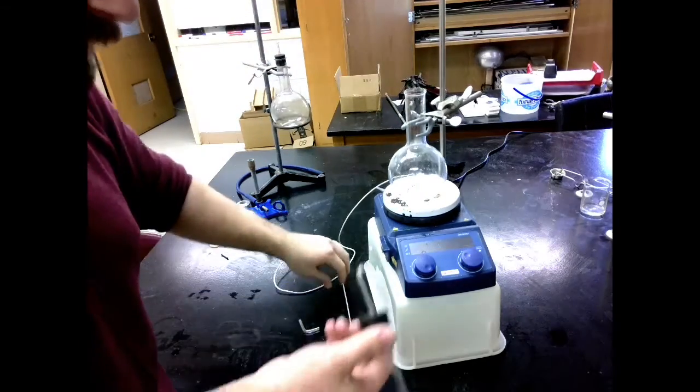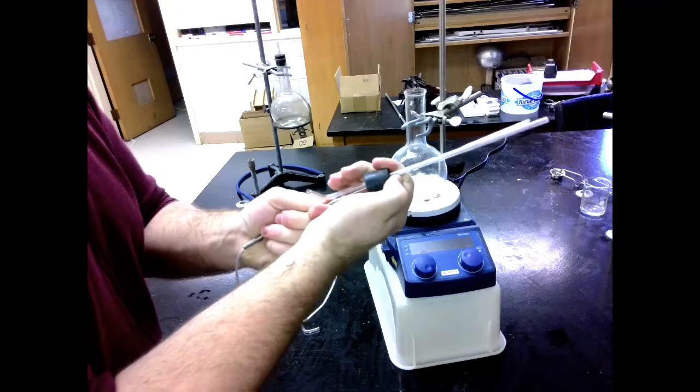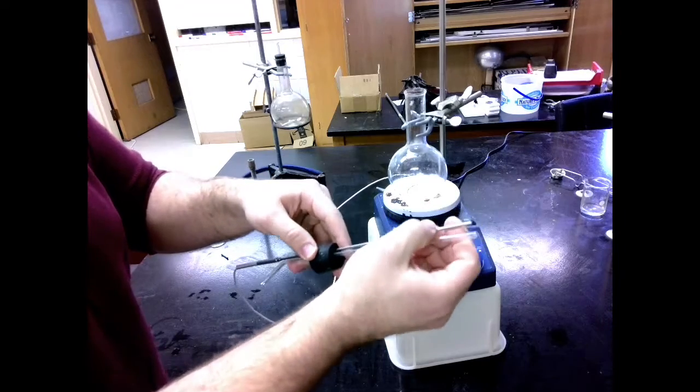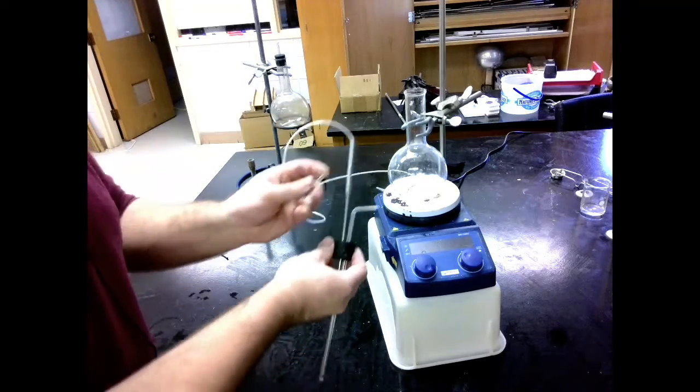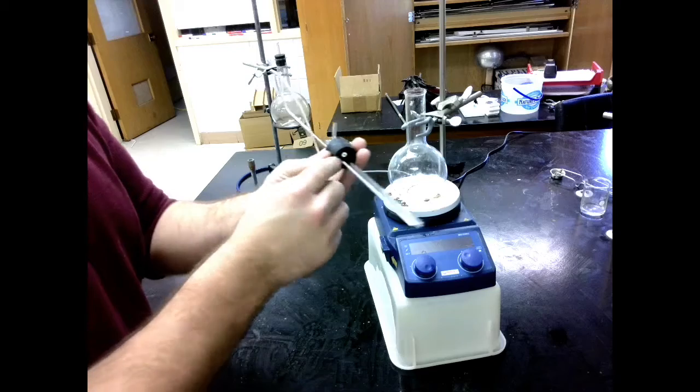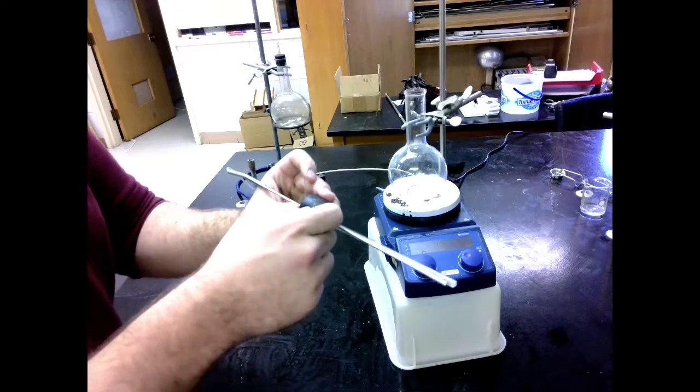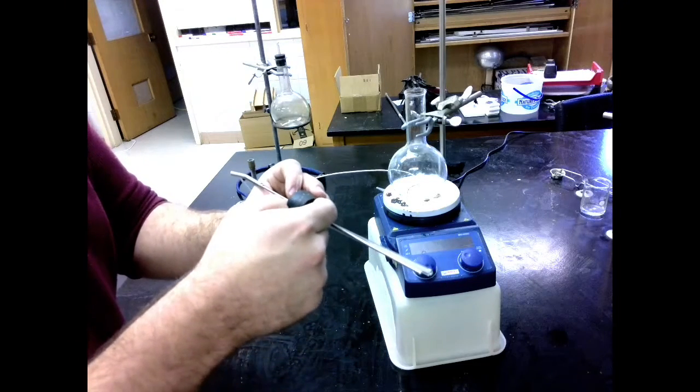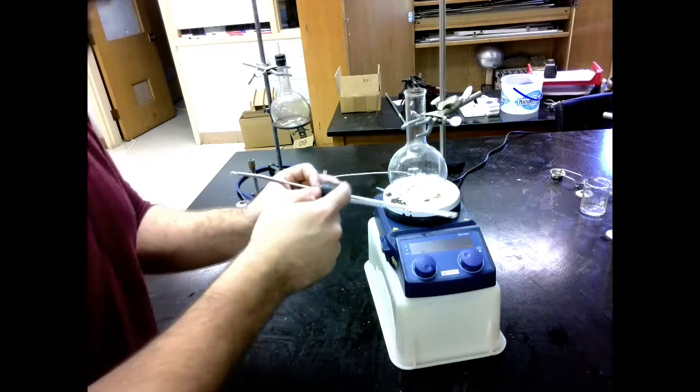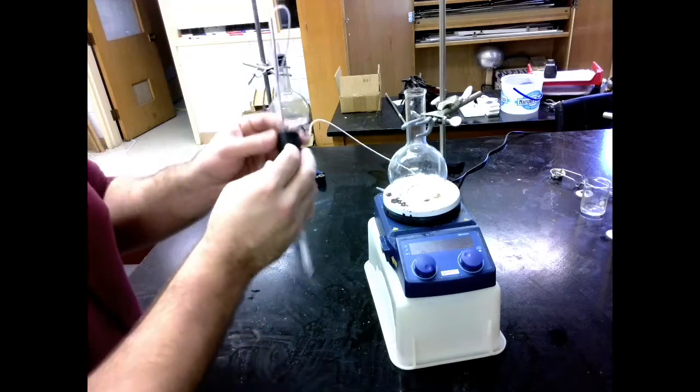I'm going to pull it out and now I'm going to put in my temperature probe. Temperature probe goes in the small hole. It should be a similar distance down in there. And then I'm going to put my small bit right in there. That should only stick out a little bit out of the bottom of the rubber stopper. The reason for that is we really want the steam to come up and go through this tube and collect here. So we've got it at the top so that as the steam comes to the top of the Florence flask, it'll move through here. Otherwise we could get steam just caught up in here and not really moving all the way through.